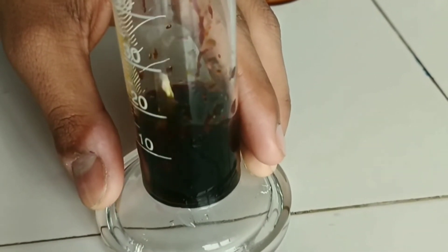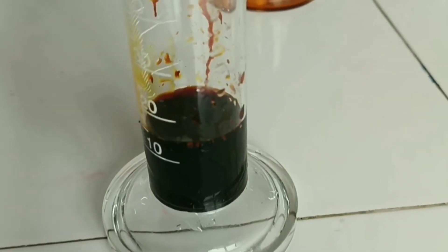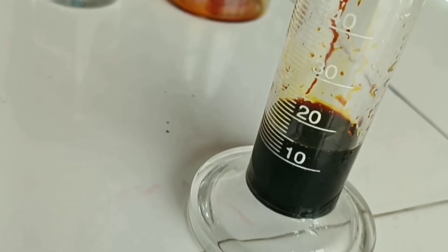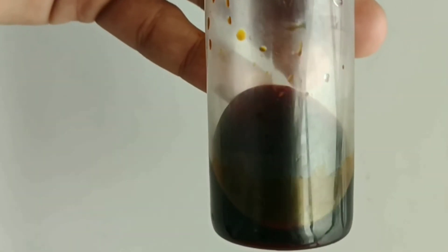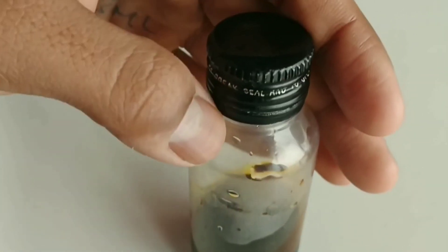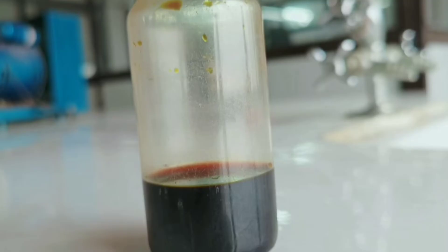Now we are adding distilled water up to 15 ml. Here you can see it is 15 ml. Now transfer this solution into a container, cap it, and label it.